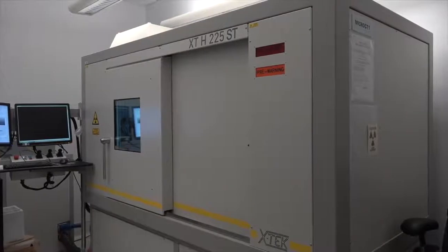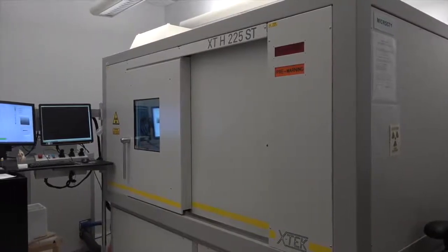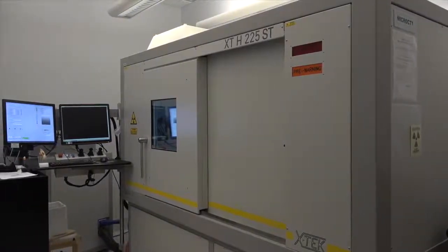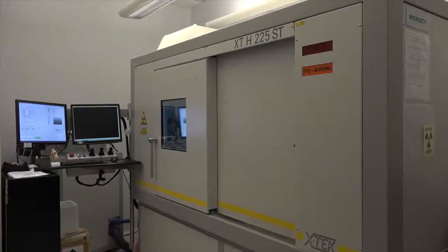First, let's talk a little about safety. The MicroCT is an x-ray generating instrument, and x-rays can be dangerous, so the MicroCT is shielded with lead.